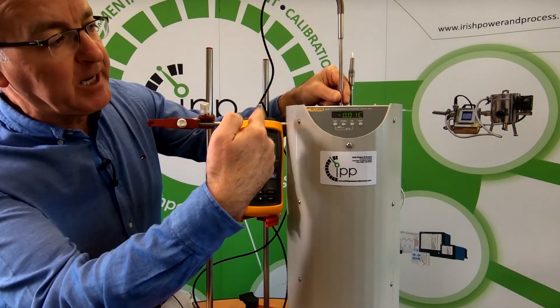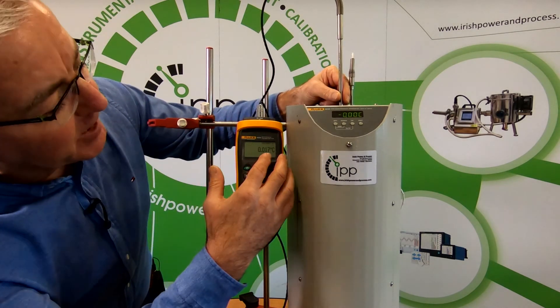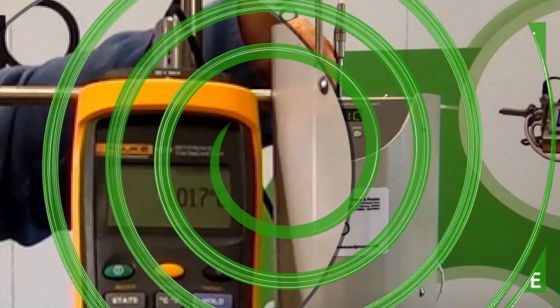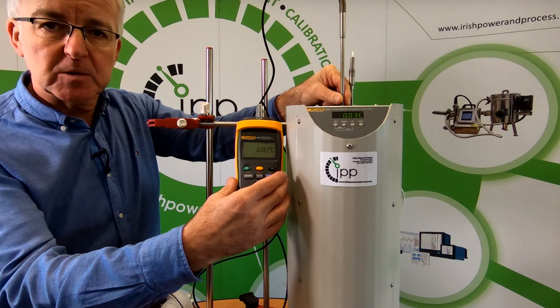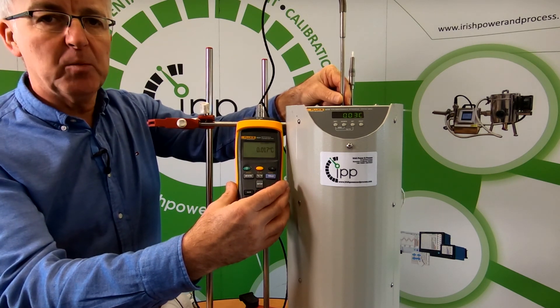We've placed the readout and probe into the triple point of water and take the reading: 0.017. We now know that this thermometer has an accuracy of 0.007 degrees C, and we can compare the resistance reading to its original calibration certificate. Now we can spend the day using this reference thermometer out in the field, carrying out good calibrations with the certain knowledge that the probe and readout are good and within their specification.